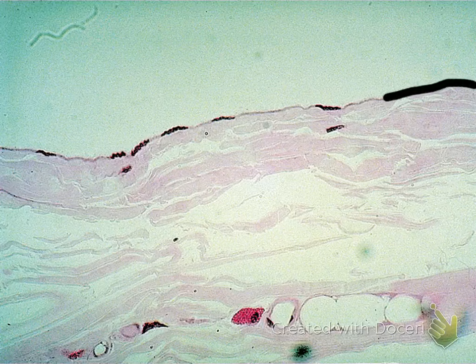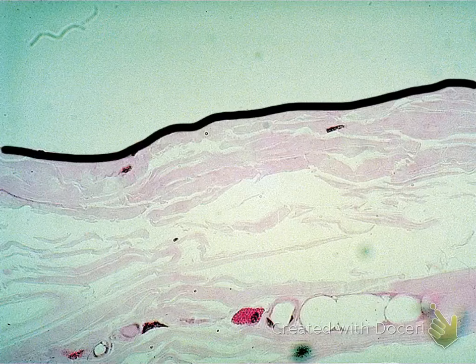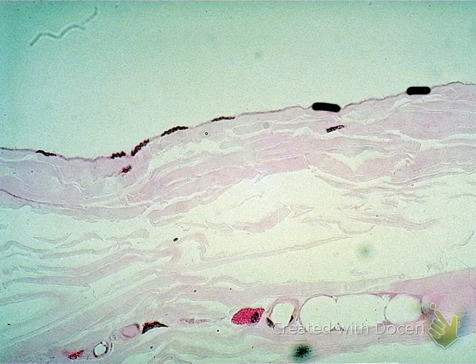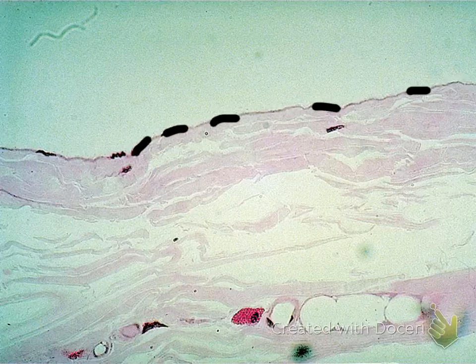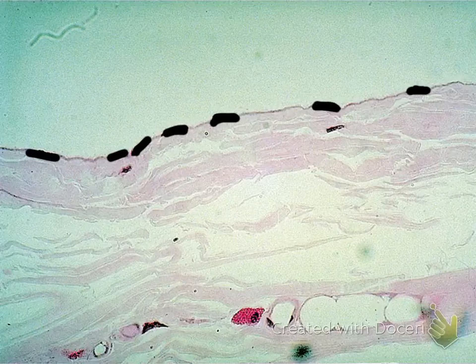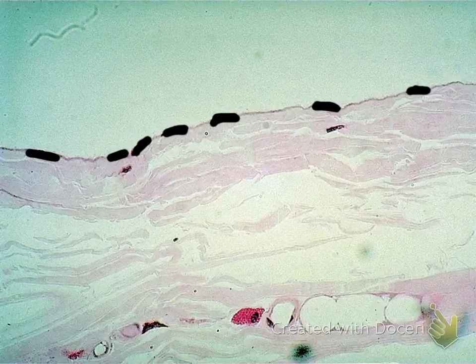There is one tiny, single, thin layer of epithelial tissue covered by that black line. Notice that there is one layer, very thin, and notice this dark structure is the nuclei — they're all flat disc-shaped. One layer of flat disc-shaped cells — this is your simple squamous epithelium.